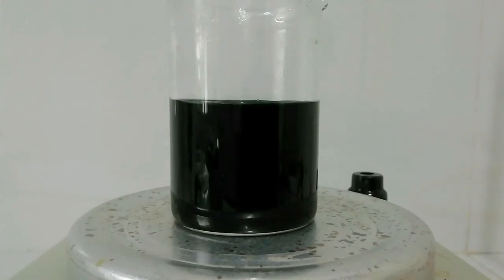That is why our solution is green in color, due to chromium 3+ ion. Now we have potassium sulfate and chromium sulfate. We need to slowly crystallize the product. I'm going to transfer this solution into an evaporating dish and keep it in a warm and dry area.